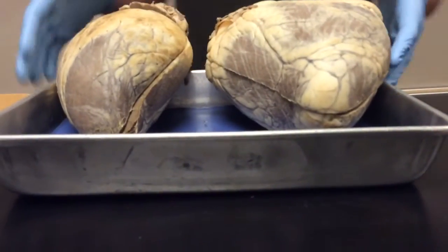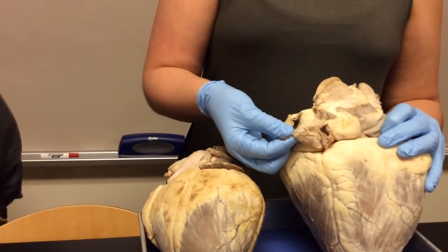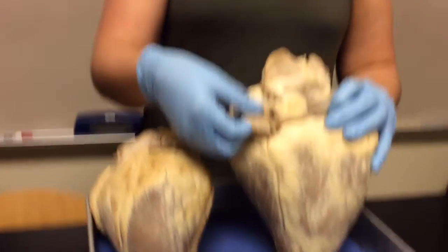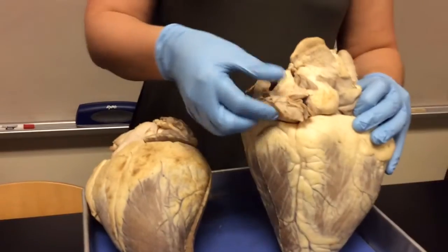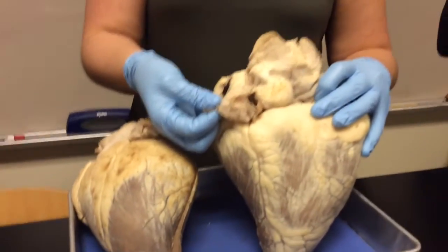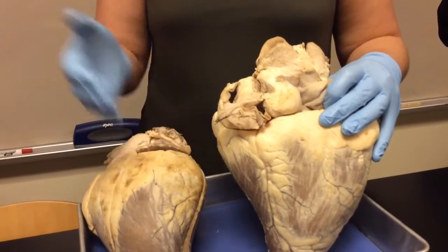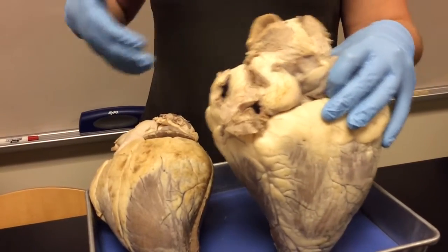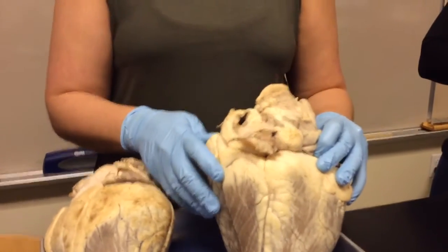So let's talk about the tissues. Looking at this posterior side, does everyone see this flap, this tissue right here? This is the remnants of what is called the pericardial sac or the pericardium. It's a dense, fibrous connective tissue that encapsulates the entire heart, but I had to cut it away so that you could see the heart, okay? What function do you think it serves? Protection. Purely protective. It reduces friction so that the heart isn't directly rubbing up against the thoracic cage or the other organs. This is the pericardium or the pericardial sac.